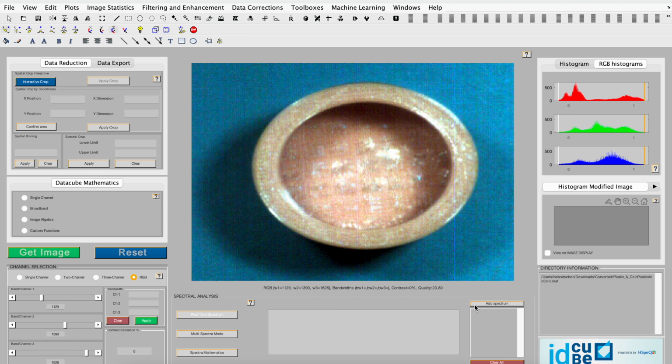Bad pixel removal is a common pre-processing step for hyperspectral datasets to remove pixels that are noisy or have other artifacts. One way to do this is to use a median filter to smooth the data and identify pixels that are more than a certain distance from the median.